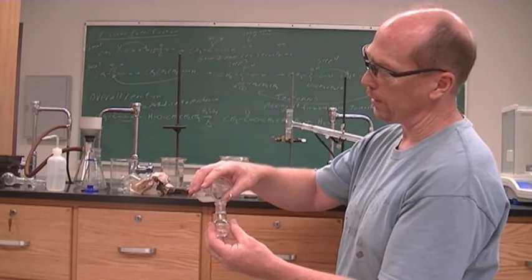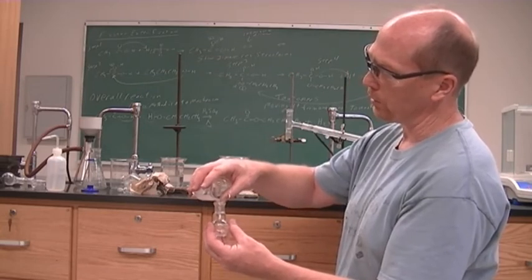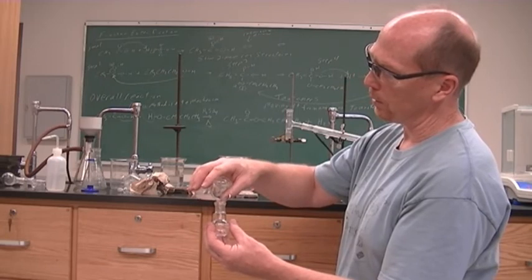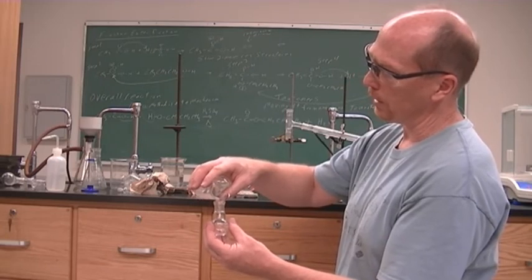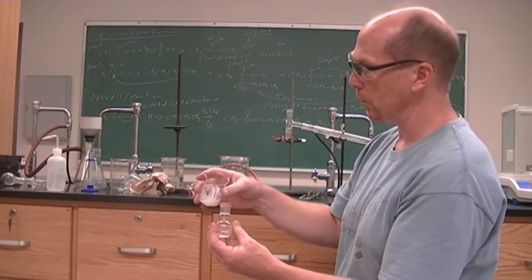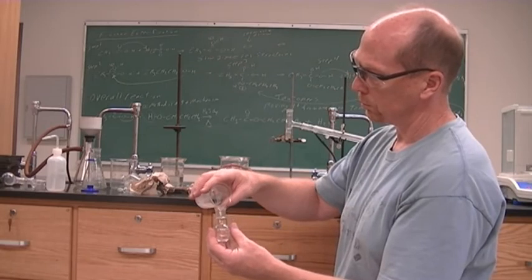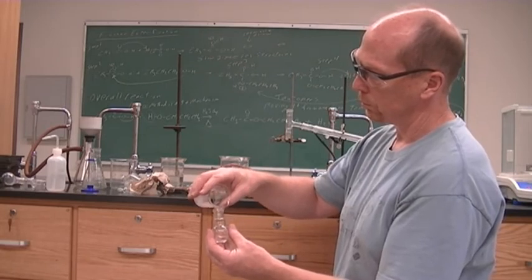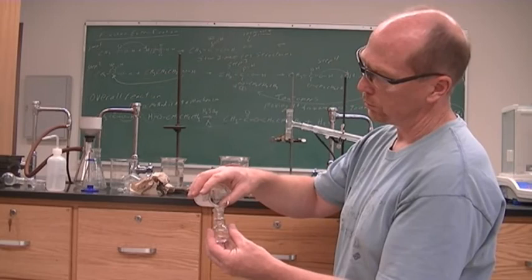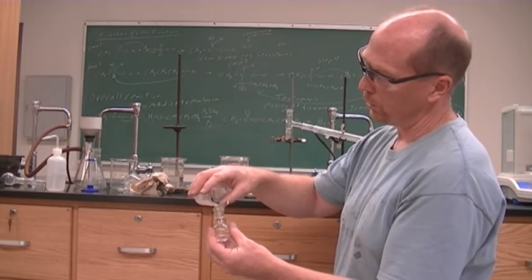Again, by drying this, you're going to lose some product because I'm trying to get as much as I can, but that solid wants to come in, and I don't want that solid to go in. A little bit of solid in would be okay.